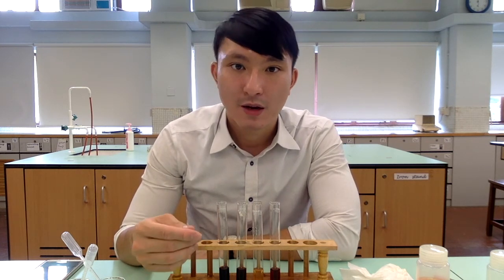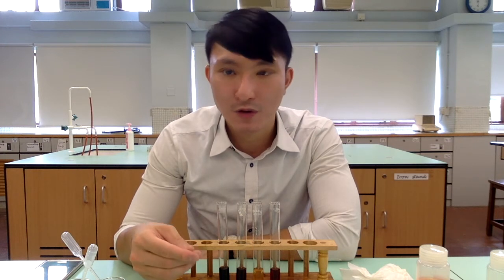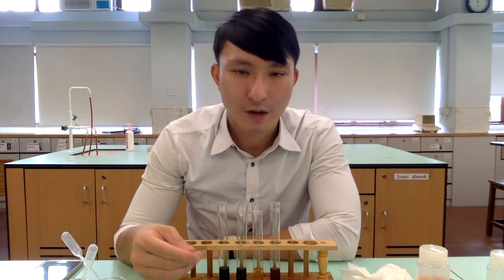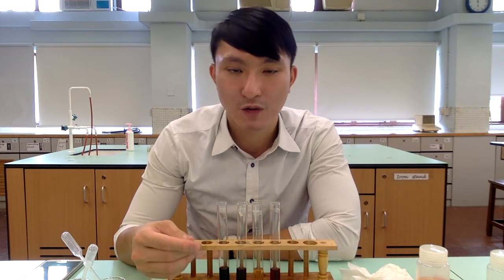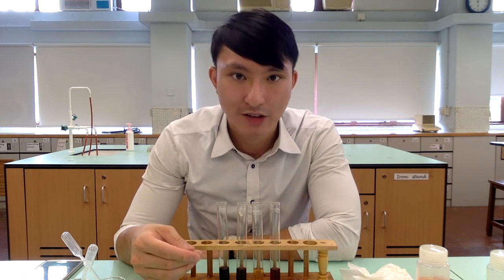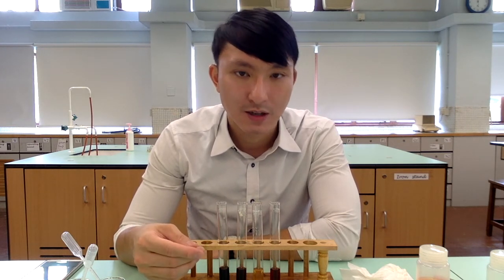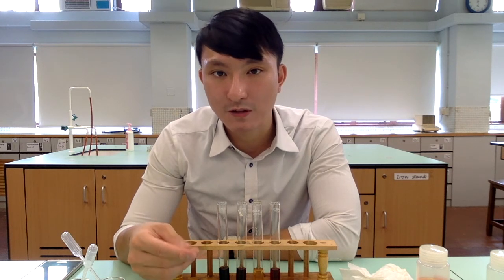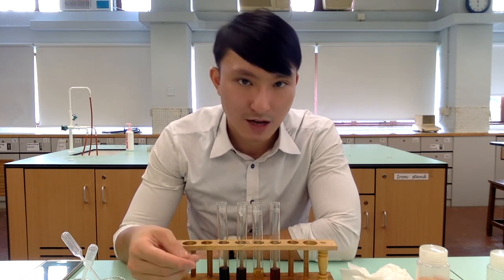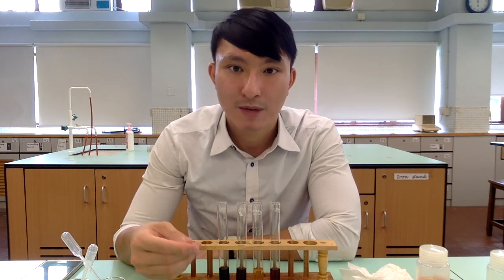For the third test tube, we add some solid sodium phosphate into the mixture. Sodium phosphate is able to precipitate with Fe3+ ion. Therefore, it decreases the concentration of Fe3+ in the reaction mixture. According to Le Chatelier's principle, the system wants to counteract the decrease in Fe3+ concentration. Therefore, it will shift the equilibrium to the left. This way, it will generate more Fe3+ to compensate the loss, but at the same time it will consume more complex ion product. Therefore, the reaction mixture appears less red, or the reaction mixture becomes paler.